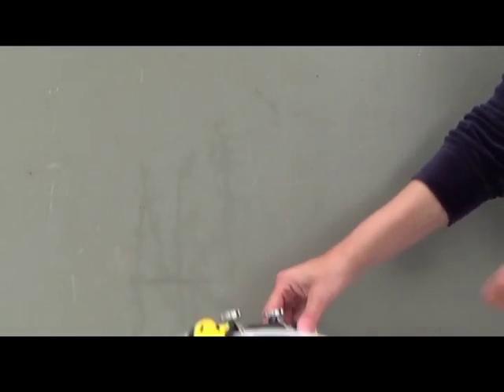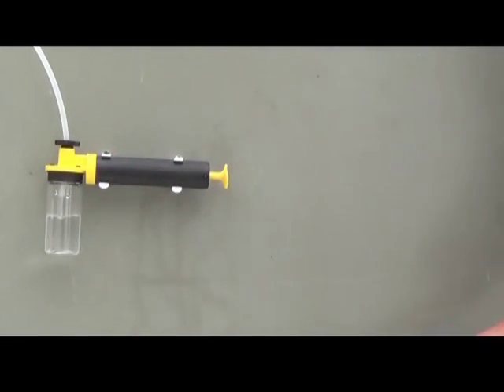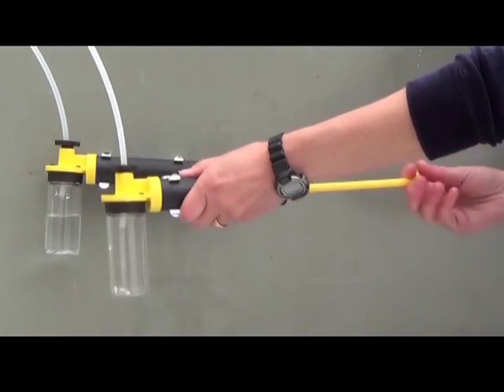In order to improve the handling technique with the fluid sampler, we recommend experimenting first with water. Water is low in density and flows quite quickly, giving immediate results, but you must pump fast.